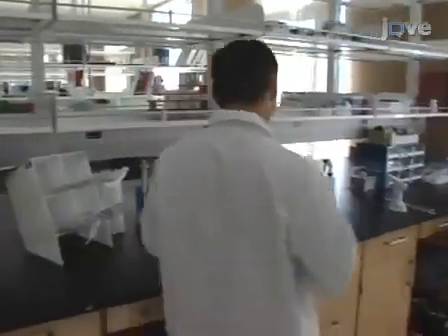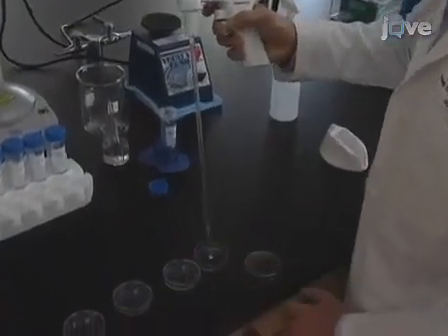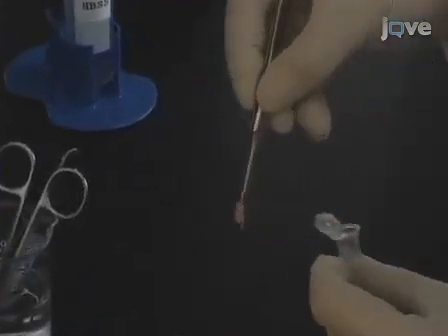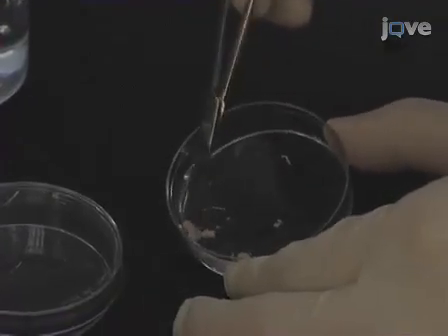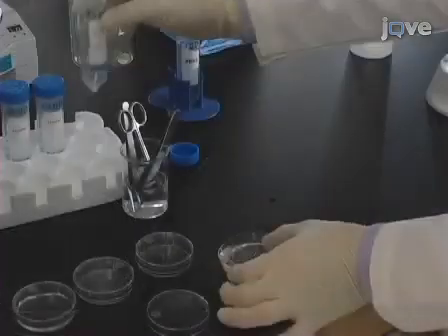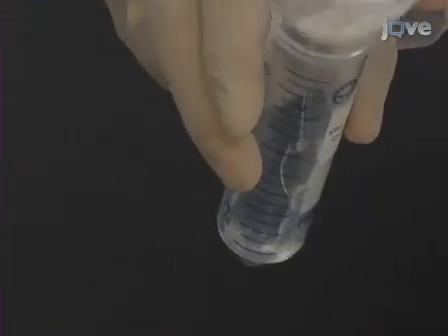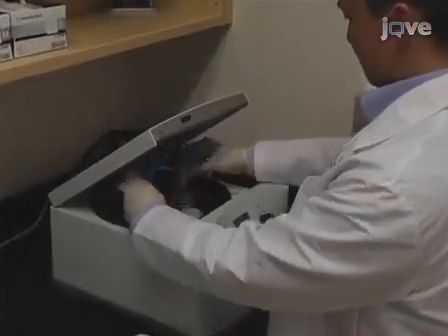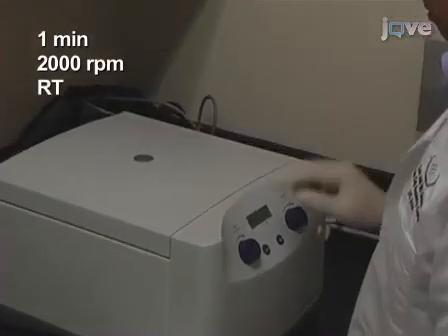Begin the dissociation of the spinal cord tissue by putting Hanks buffered saline solution, or HBSS, in a petri dish. Then, using fine scissors, mechanically dissociate spinal cord segments T8 through T10 of uninjured control or contusion-injured spinal cord tissue at T9. Dissociation of an uninjured spinal cord is shown here, but the dissociation of the contusion-injured spinal cord can be done in parallel. Centrifuge the tissue bits in a 50 milliliter tube for 1 minute at 2000 rpm at room temperature.